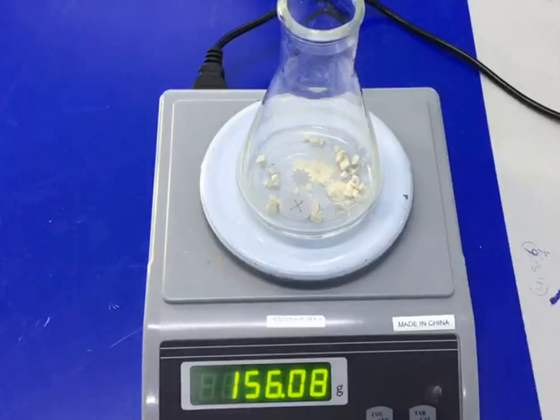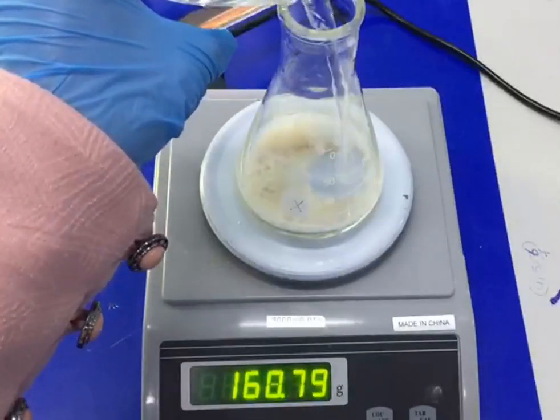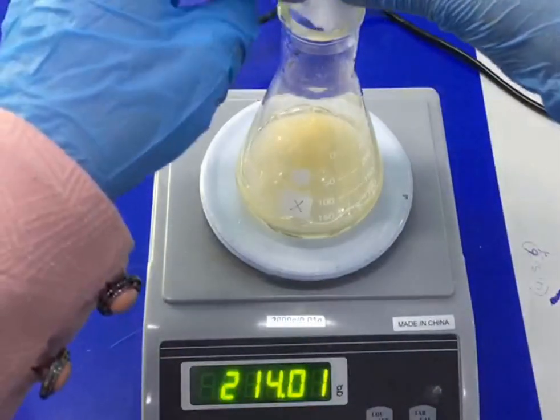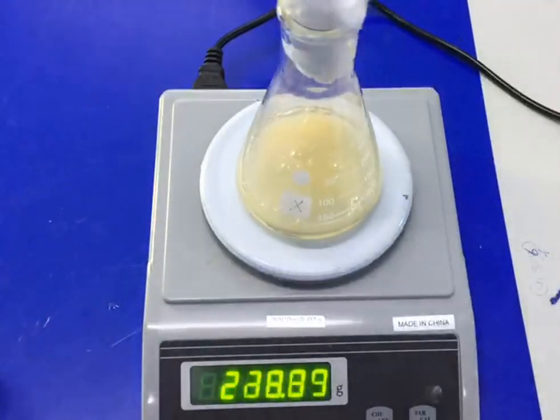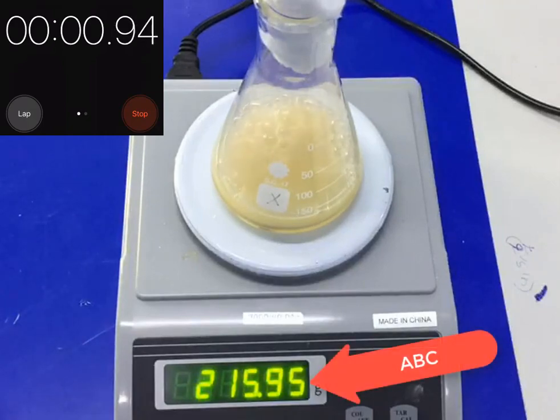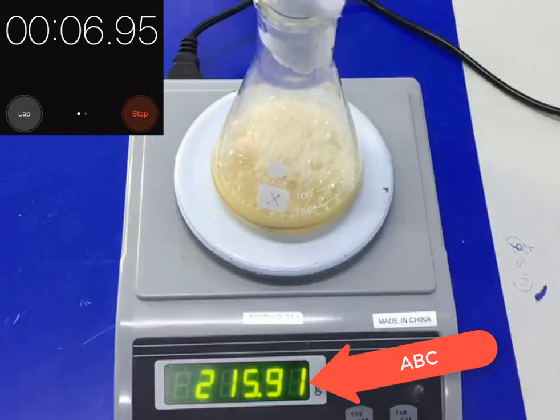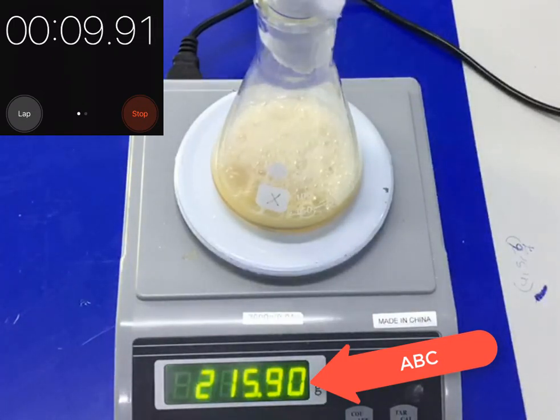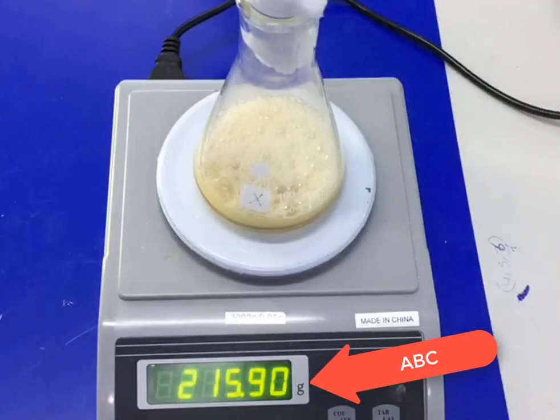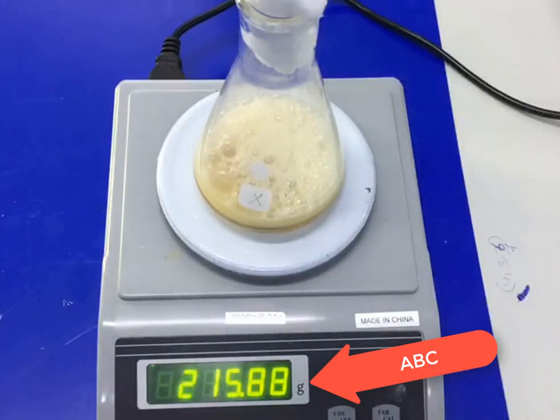After adding the small calcium carbonate chips, we add a fixed volume of hydrochloric acid, then place a cotton wool plug into the neck of the flask. This stops liquid from spitting while allowing carbon dioxide to escape. We begin taking mass readings straight away using a stopwatch and continue until there is no further change in mass, then repeat the experiment using the same mass of calcium carbonate but in larger chip size.